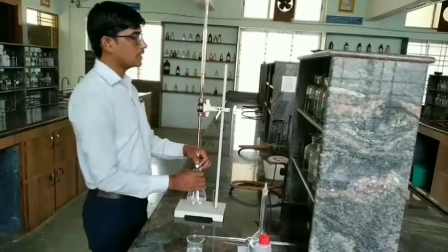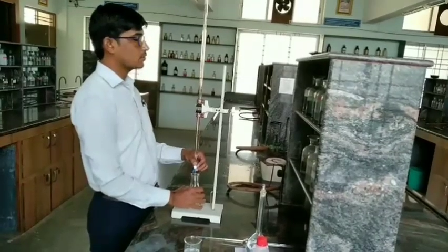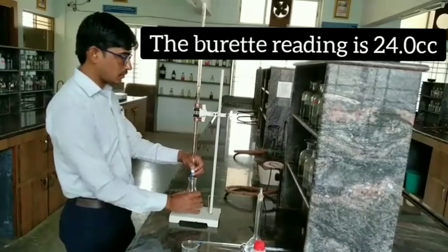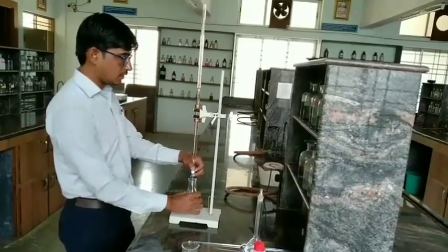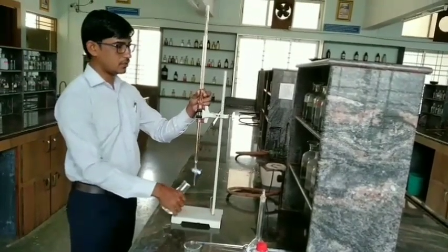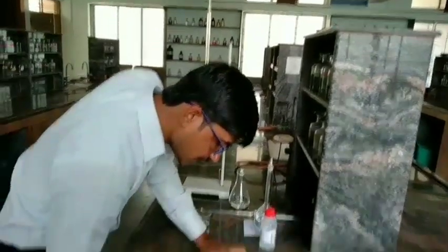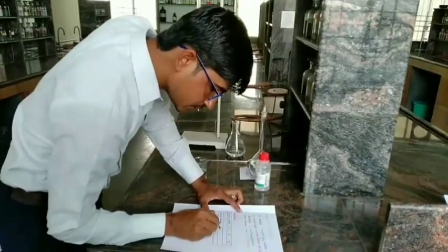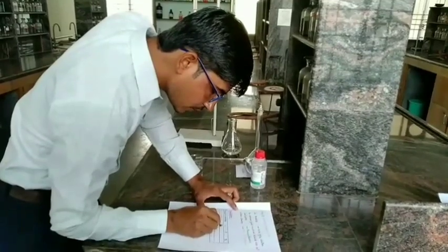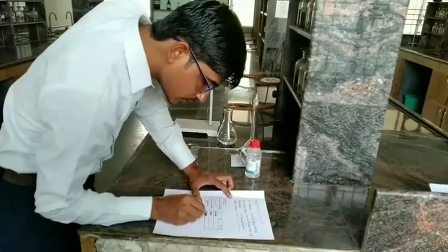The color is changing from pink to colorless. The burette reading is exactly 24 cc. The initial reading is 0.0 cc, the final reading is 24.0 cc, and the difference is 24.0 cc.